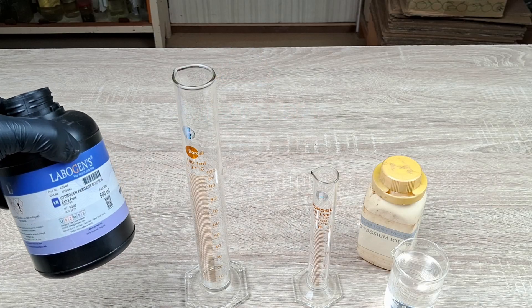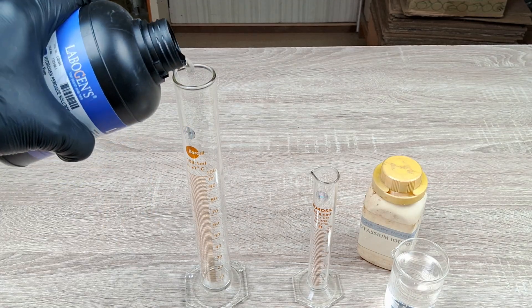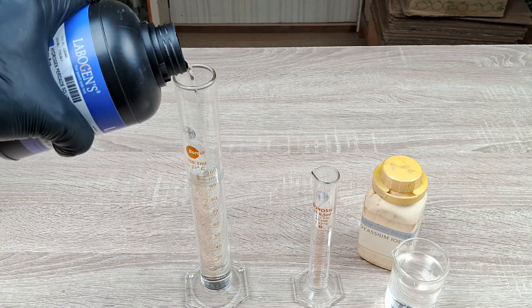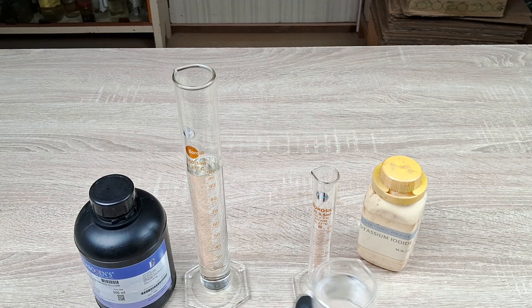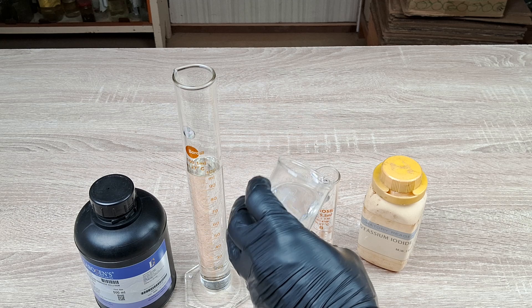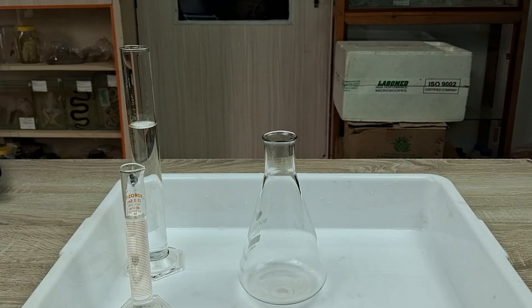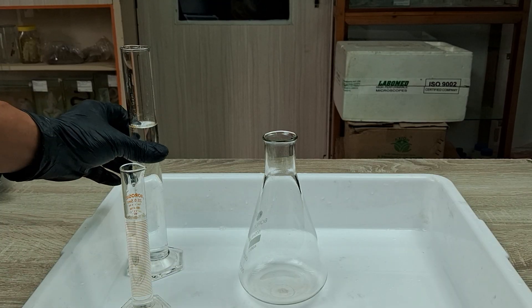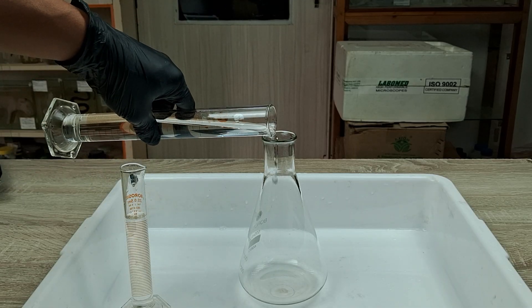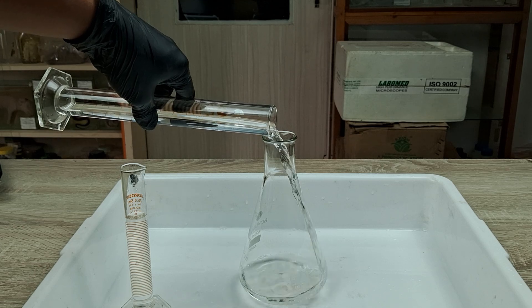To perform the experiment, first measure about 100 ml of 30% hydrogen peroxide and about 20 ml of the saturated potassium iodide solution in two separate graduated cylinders. Next, take the Erlenmeyer flask and place it on a tray that is large enough to accommodate overflow. Then pour the 100 ml of hydrogen peroxide into the flask.